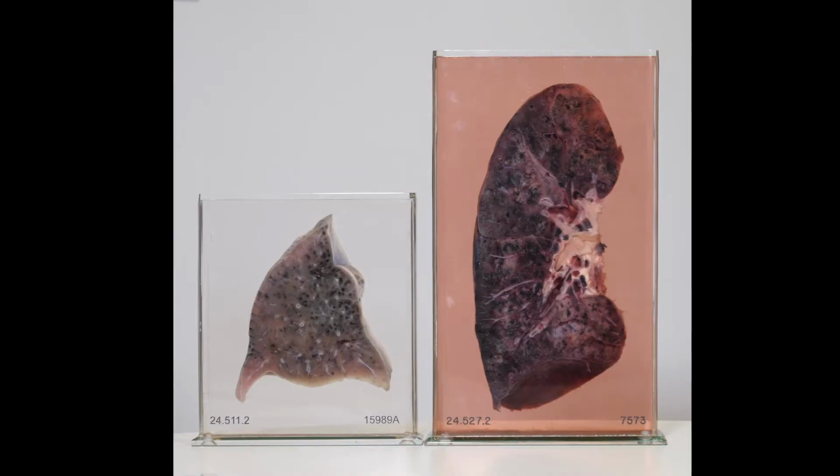The first lung specimen is a section of the right lower lobe. We can see several small pale foci of consolidation throughout the whole lung. As you can see here and here, they are mostly prominent in the subpleural lobules. Whilst the whole lobe is hyperemic, the parenchyma does not appear to be consolidated between the pale foci.